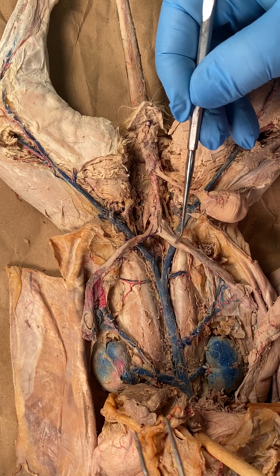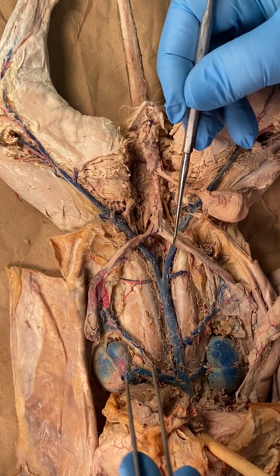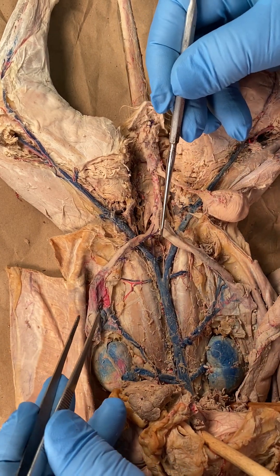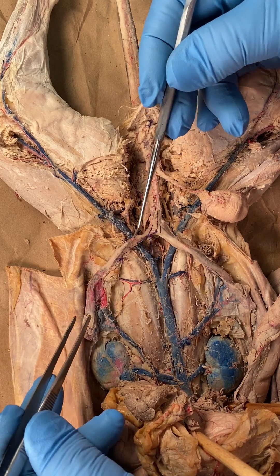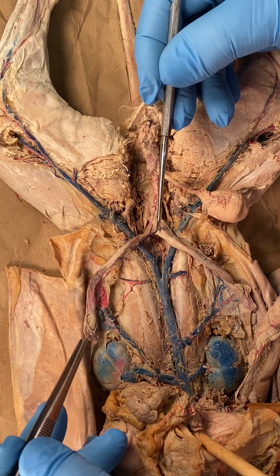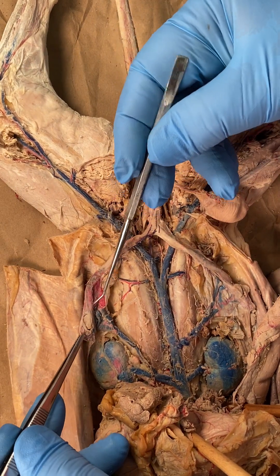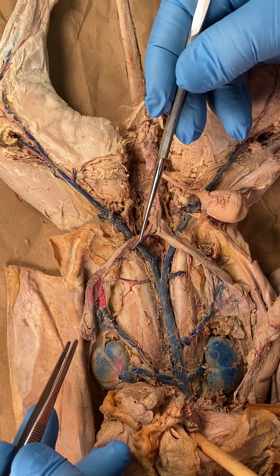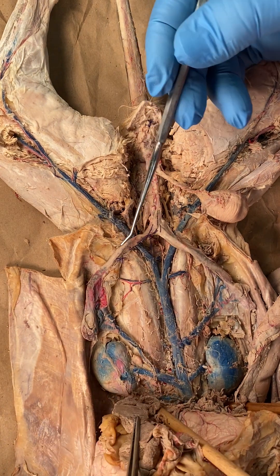Cats have uterine horns because that allows them to give birth to many kittens at one time — three, four, even five or six at a time. They will be found inside the uterine horns. So cats do have the fimbriae and fallopian tubes, and those are the structures you need to be able to identify in the female cat.